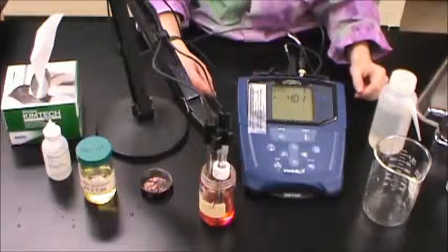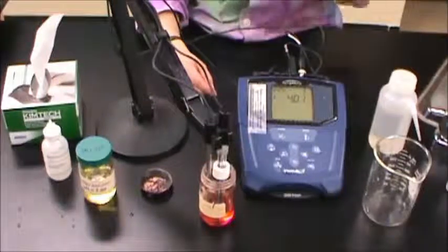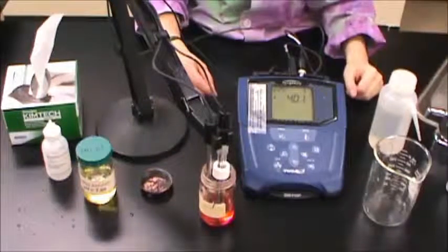The instrument can now be used to measure the pH of samples as needed, as long as the probes are rinsed with deionized water between samples.